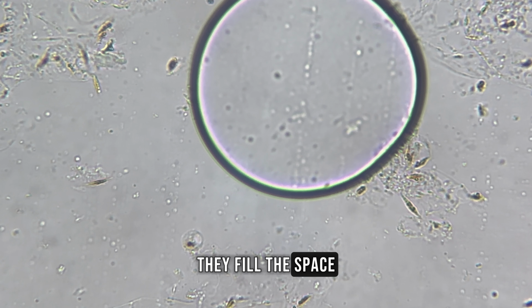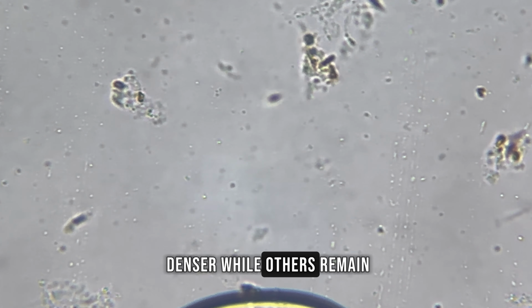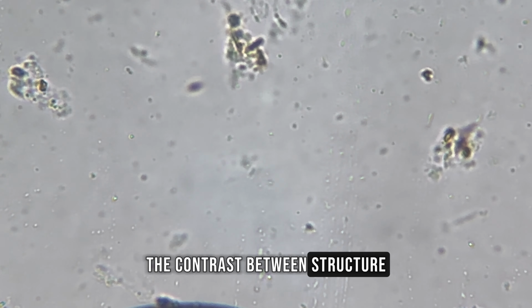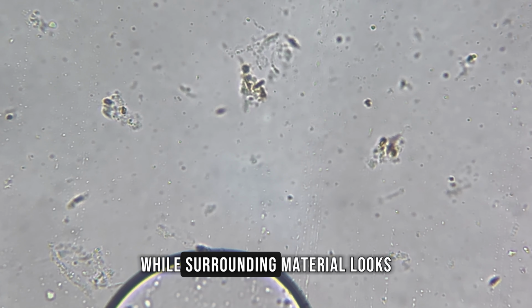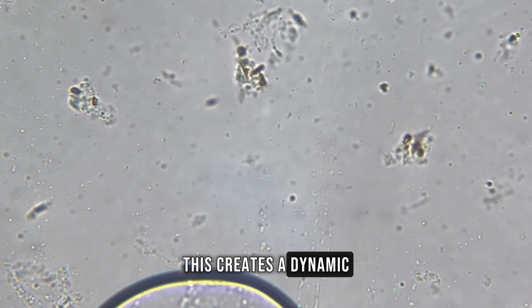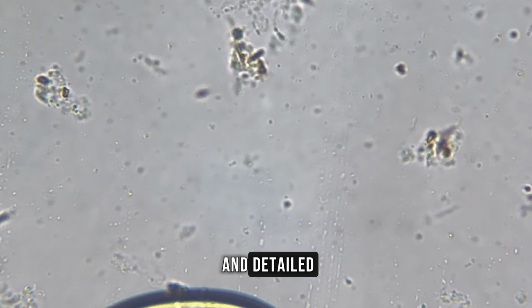They fill the space unevenly, creating textured regions. Some areas appear slightly denser, while others remain almost empty. The contrast between structure and liquid becomes much stronger. Fibers appear to hold shape, while surrounding material looks soft and diffuse. This creates a dynamic visual balance. The image feels active and detailed.